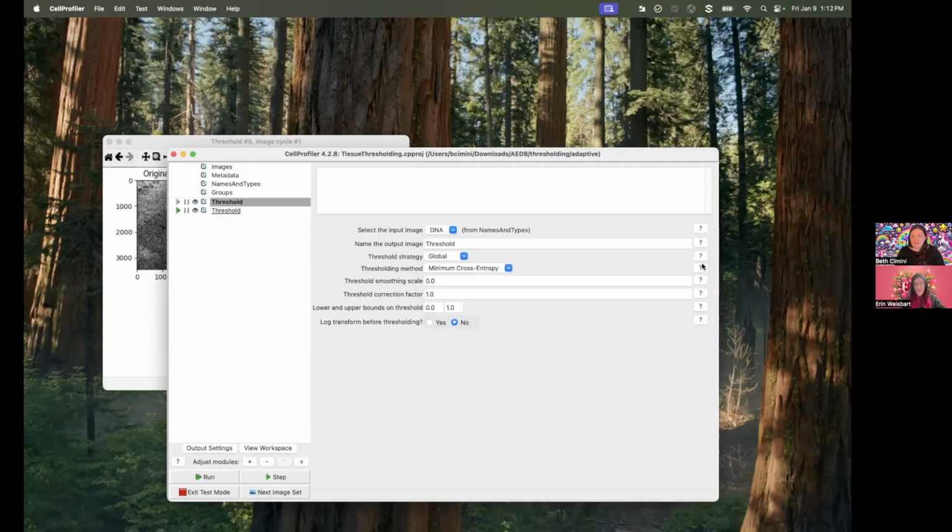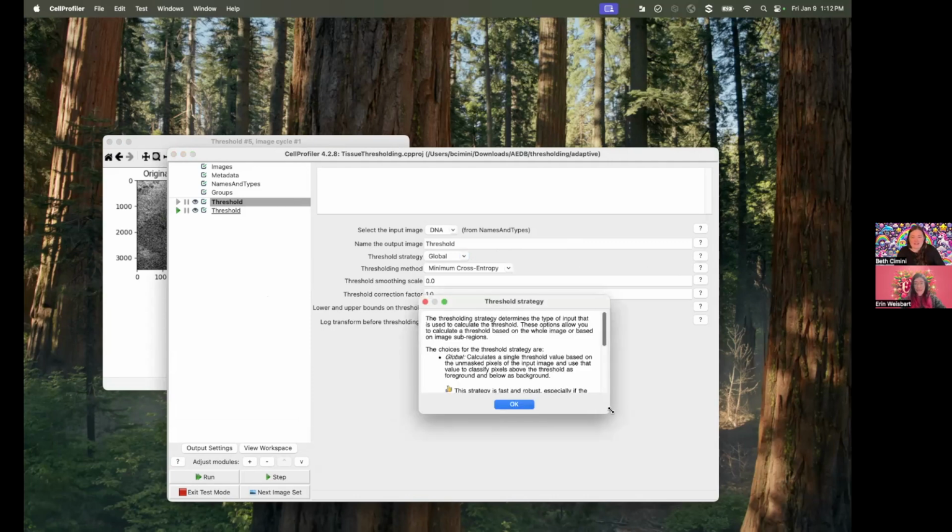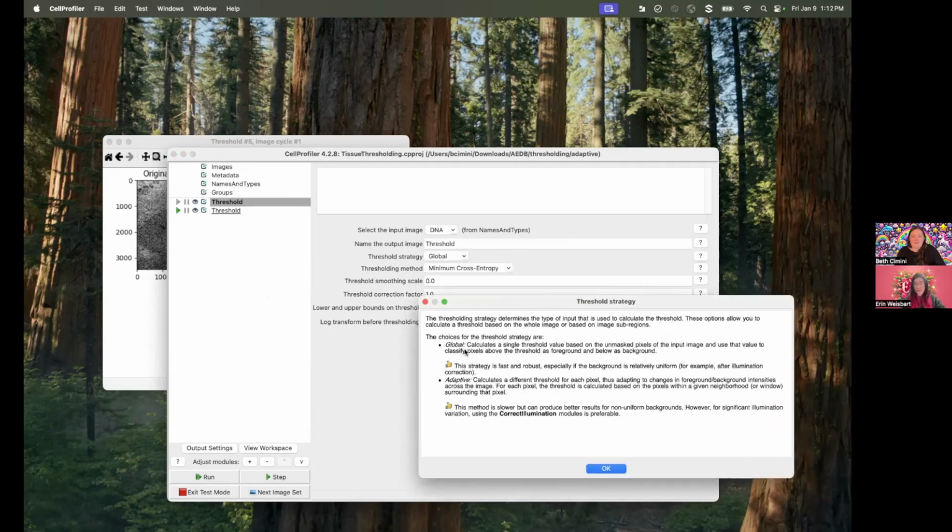Here, the default in CellProfiler is global. But there's actually two options here. There's global and there's adaptive. And if you're ever not sure what a particular setting is doing in CellProfiler, a reminder that the most important buttons in CellProfiler are these little help buttons, which are next to every single setting. Every single setting has biologist-written help text. And it tells you what these two different modes are, and when you should use them.